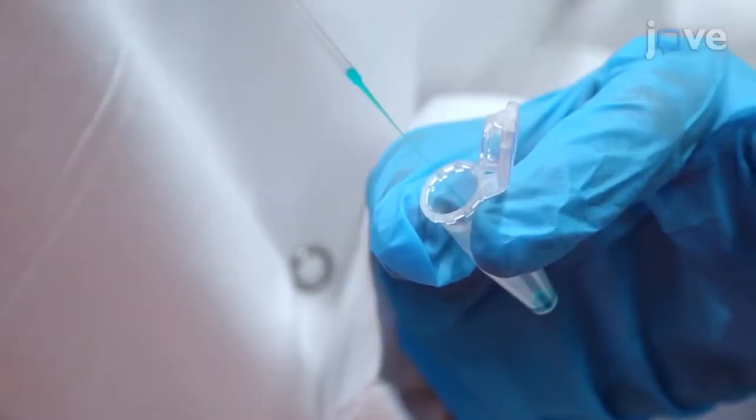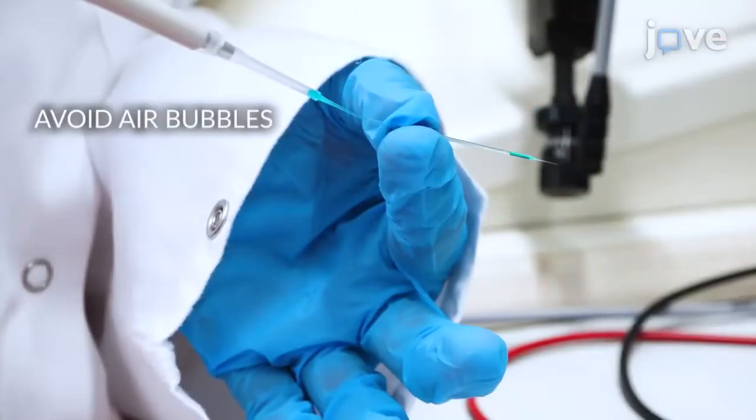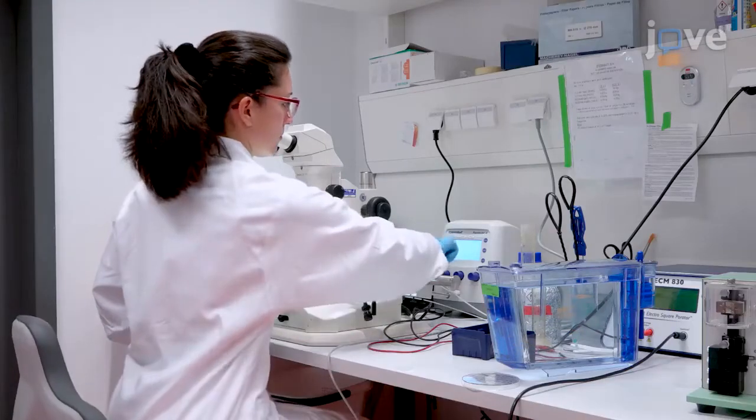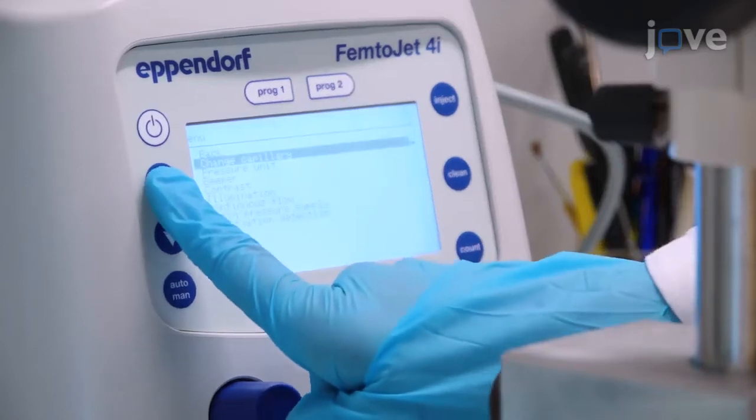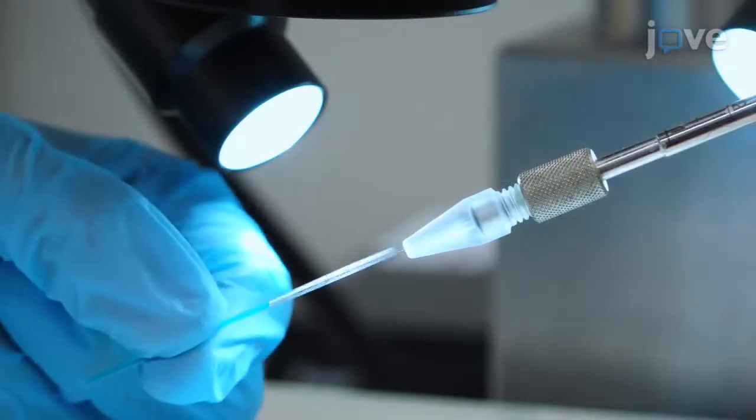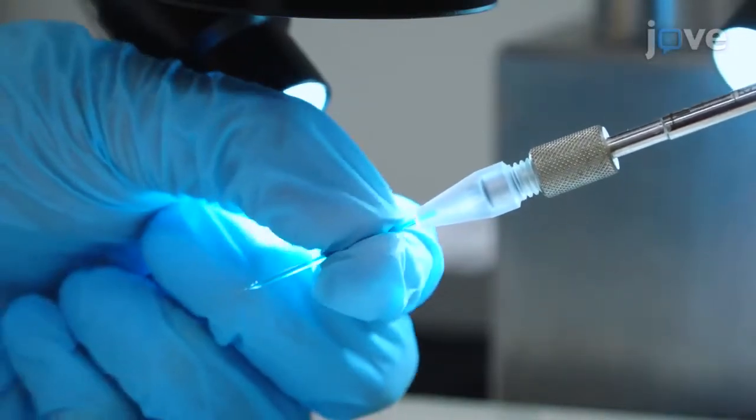Use micro-loader tips to fill a prepared glass capillary with 10 µL of plasmid solution, and press menu change capillary on the injection device to allow the needle to be loaded into the needle holder, and switch the injection device from change capillary to inject mode.